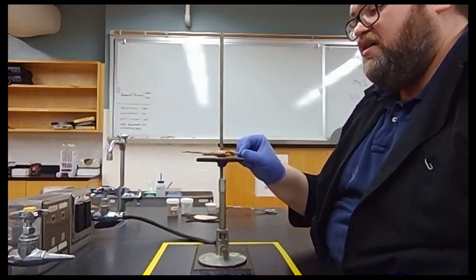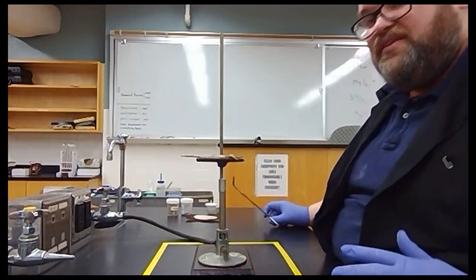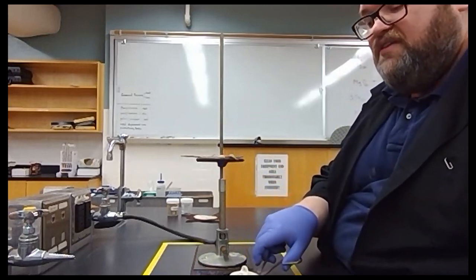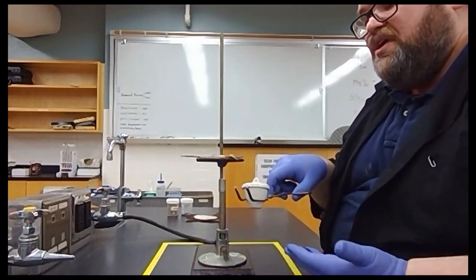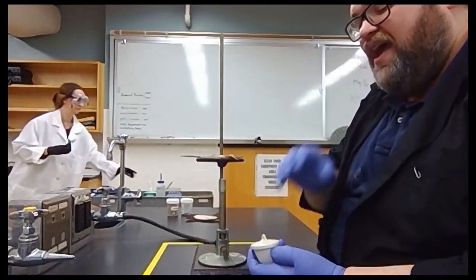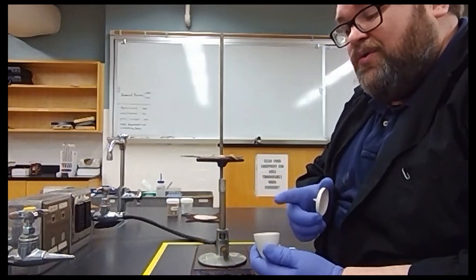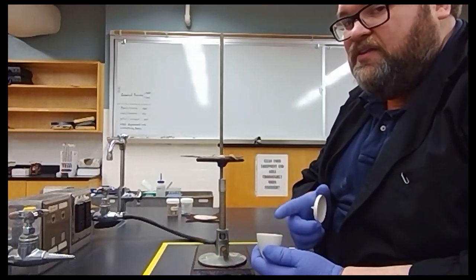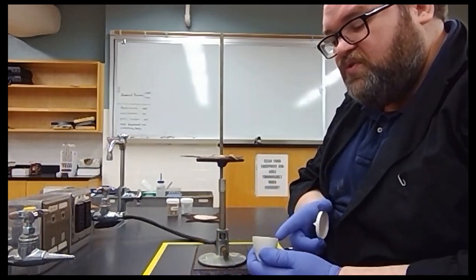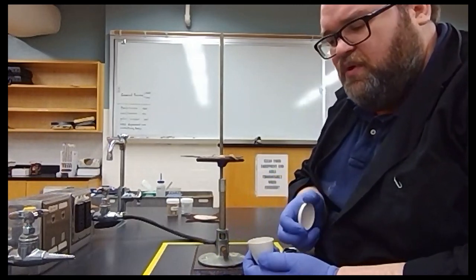Okay, so we're going to temper our clay triangle, then set that down, and then now we have an extra step that we need to do. These crucibles are very, very absorbent. They're very porous. So anytime somebody has touched them with their hands, oils and debris and skin cells and things like that can get stuck to the outside or the inside of your crucible. We need to get that cleaned off, and soap and water is not going to help us here because that soap and water can also get stuck in those pores. So we need to figure out a way around that. We've already got fire, so we could just burn it off, and that's exactly what we're going to do.